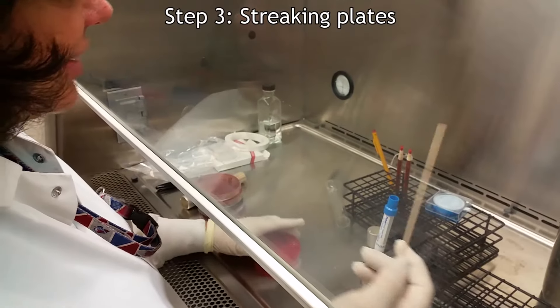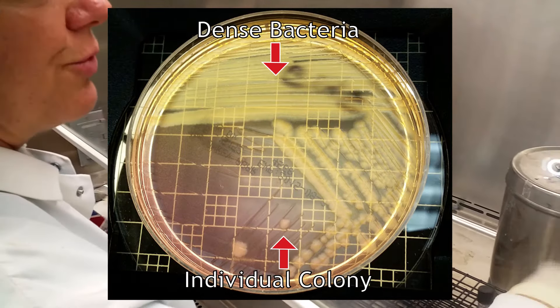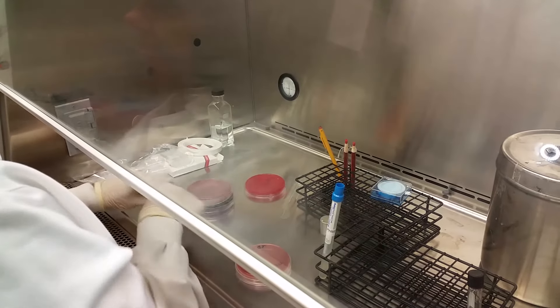Next, the laboratorian must streak the plates to thin out the applied bacteria, allowing individual colonies to be isolated after incubation occurs.